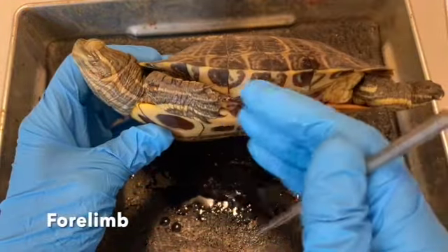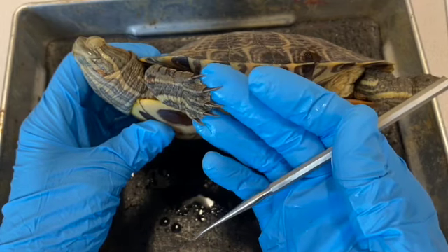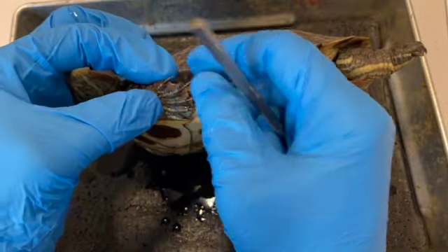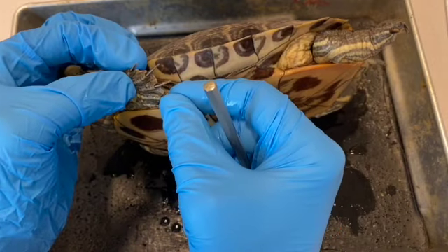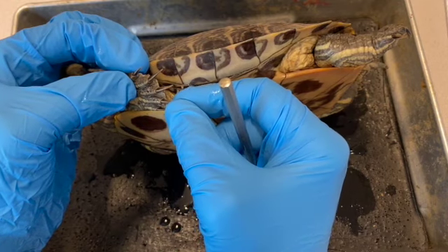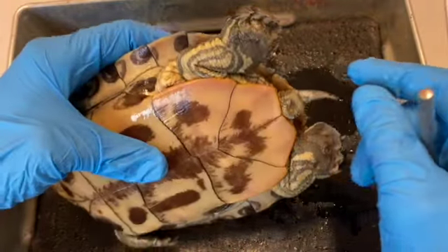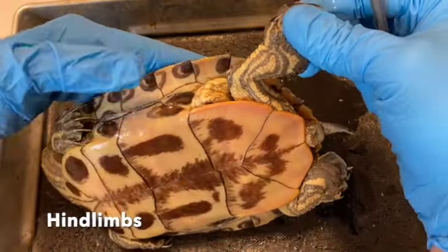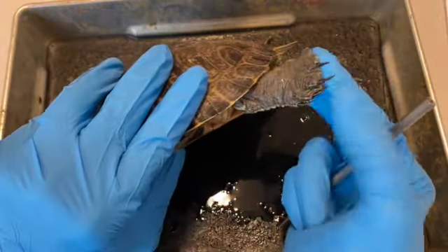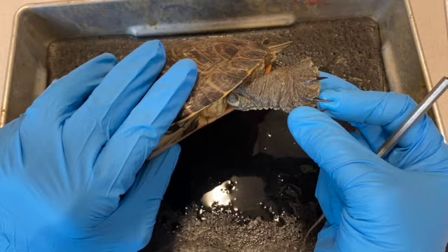Here we have a forelimb. The forelimb, as you can see, has 5 digits and long, sharp claws. Also, if you extend the digits away from each other, you can see that they also have webbed appendages that aid them in swimming, since these animals spend most of their time in the water. The posterior, or the hind limbs, are actually physically longer than the anterior or forelimbs. They also have long claws, webbed digits, and they're very good swimmers.